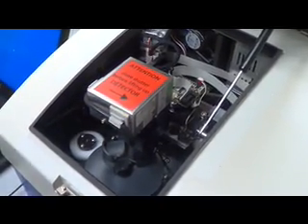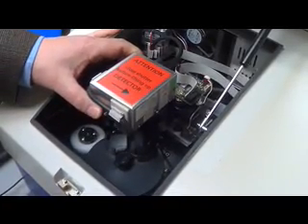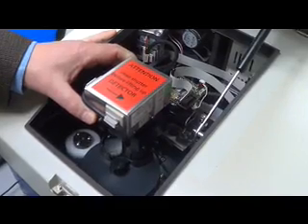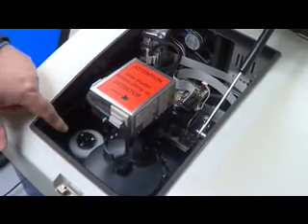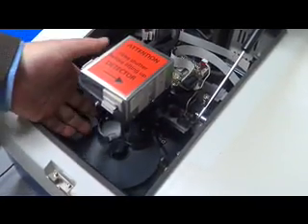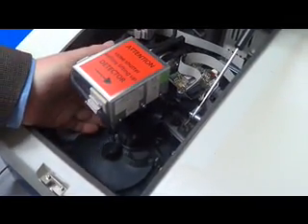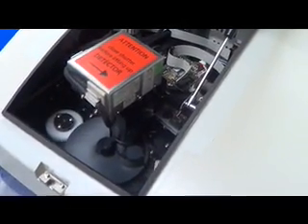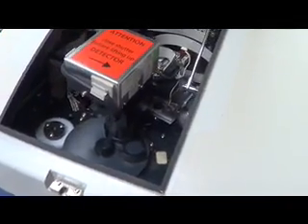After the instrument is off, make sure the PMT is in position with the shutter closed before lifting up the detector. The shutter is located down next to the filter slide — all you have to do is push gently to the right and the shutter is now closed. Closing the shutter protects the PMT from excessive light.